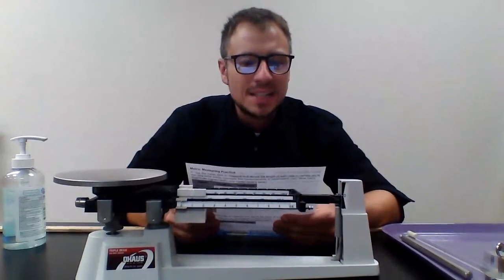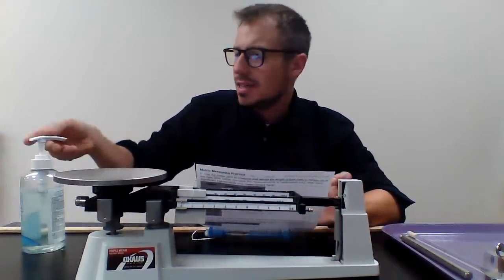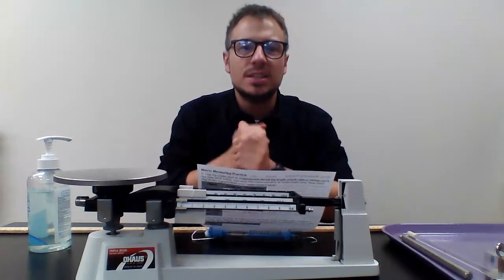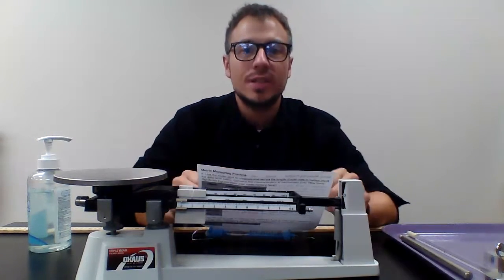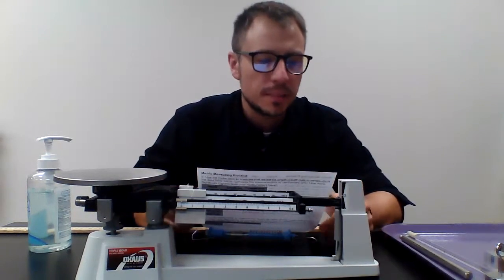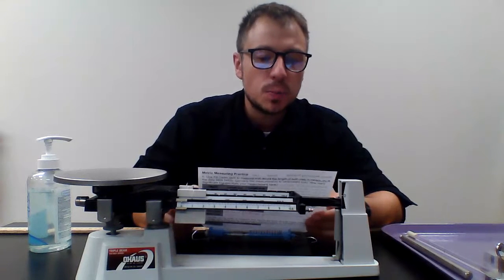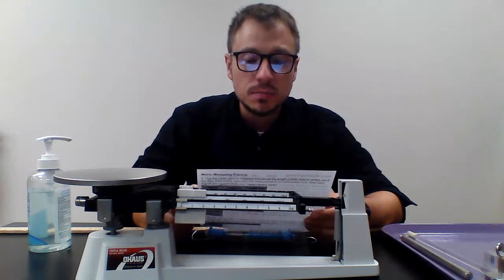This is the Metric Measuring Practice Lab. First thing I'm going to do is get a little hand sanitizer on my hands to make sure any germs on my hands do not get onto the lab equipment. The purpose of this lab is to practice measuring using the metric system.